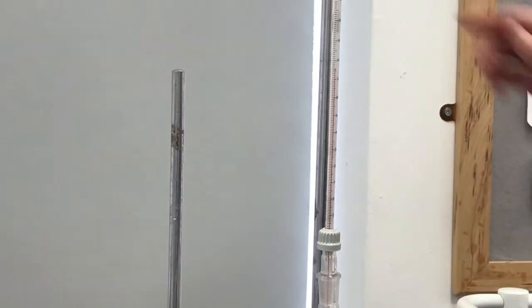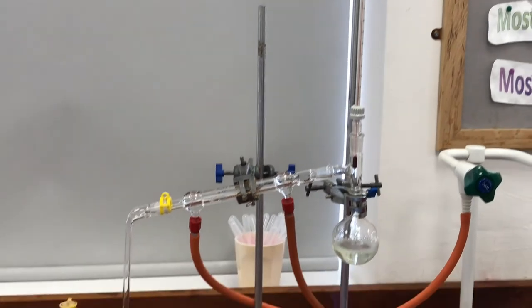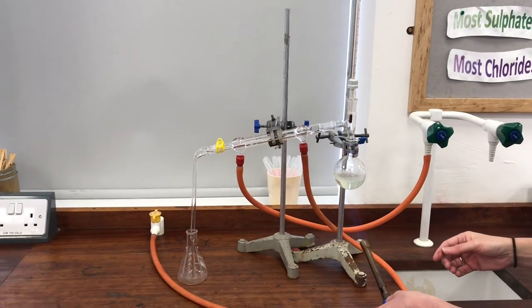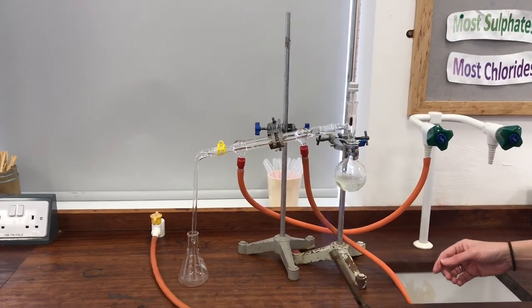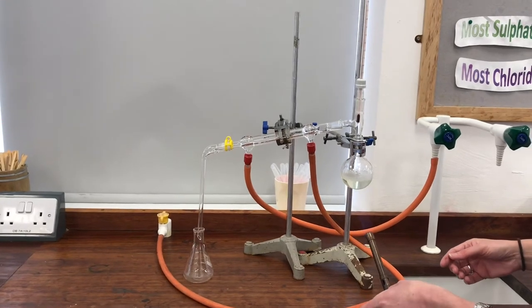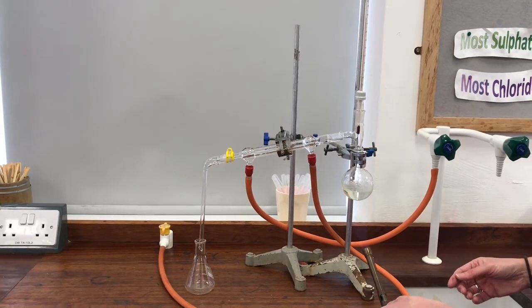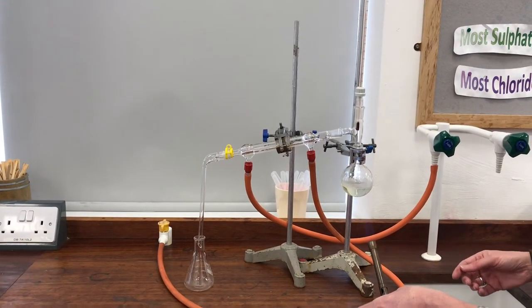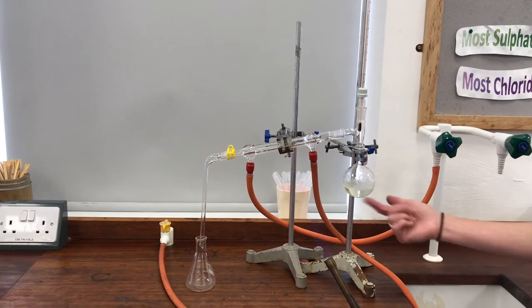Yeah, it's almost up to exactly the right temperature, so I want to keep that at 78 like I said, in order to make sure I'm just getting ethanol boiling over, and it will effectively separate my ethanol from my water that's in here.